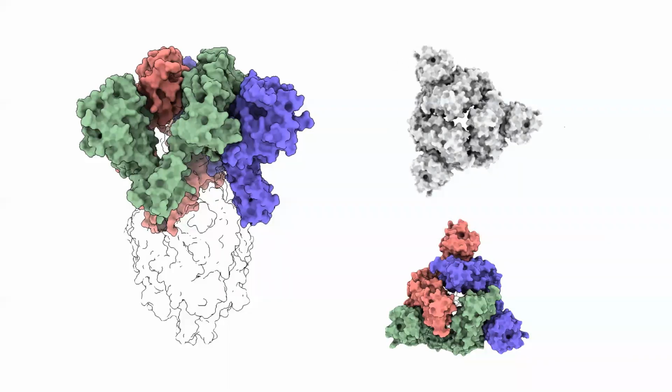Okay, some of the questions that are posed here. Why don't we use BLAST? Yes, for sure, you can use BLAST. BLAST is local alignment, so it's not going to work well for the full genome. So for full genome, you use multiple sequence alignment. What is TaxID? As we looked at, there's a taxonomy of these viruses, so we use that to associate them with different substrains, genera, species, etc.